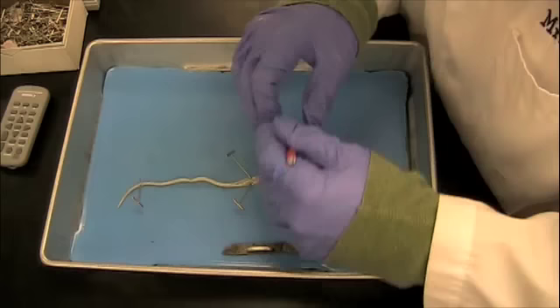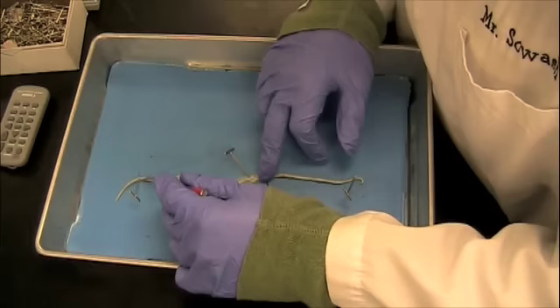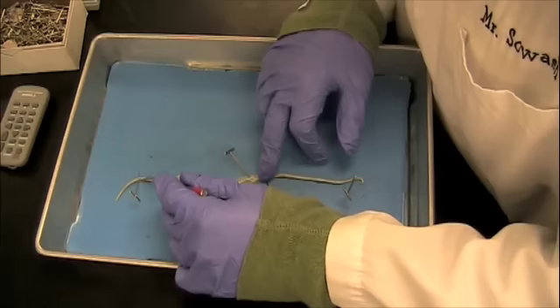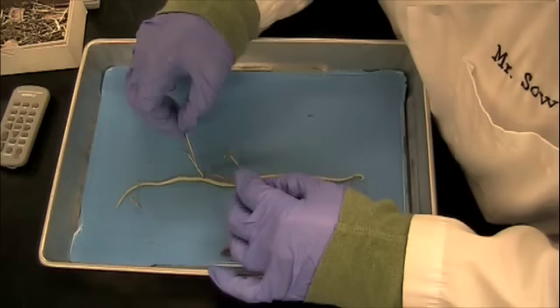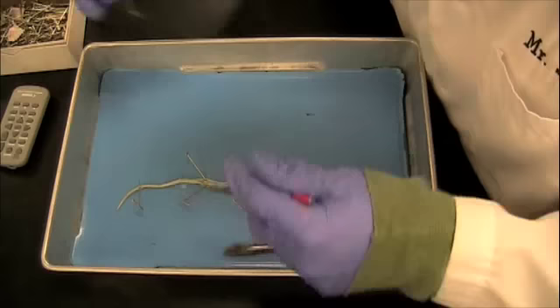I'm going to use my probe to finish separating any of the Ascaris that hasn't completely been opened by the scalpel. And as I do this you begin to see the internal structure of the Ascaris.